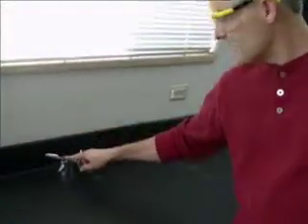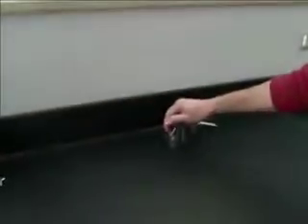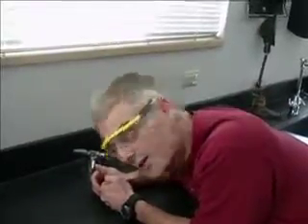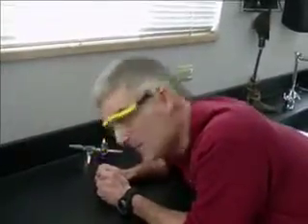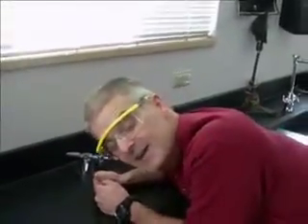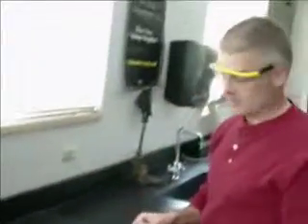All right, I happen to have a gas jet right here, and this has natural gas, or methane gas, coming out of it. I can turn the gas, and you can hear it hissing. What the student did is he had a lighter. He was a smoker, and he said, Mr. Bergman, what would happen if I did this? He had his face right in front of the gas jet with his lighter. Well, I'm not going to put my face right in front of it. Luckily, I screamed loud enough. He did not do what I'm about to do. So we're going to do this on a much safer basis.